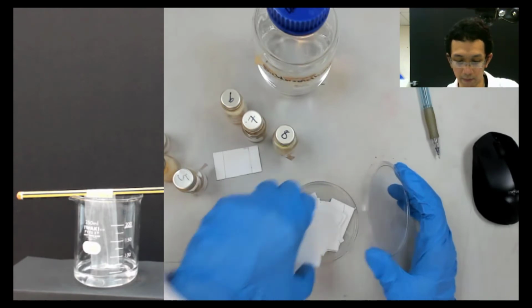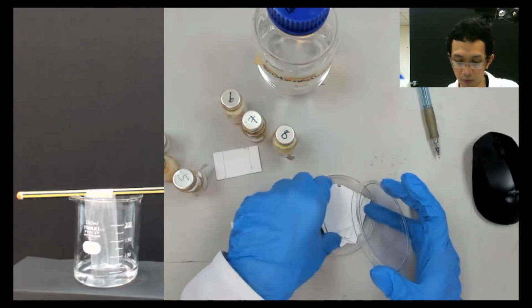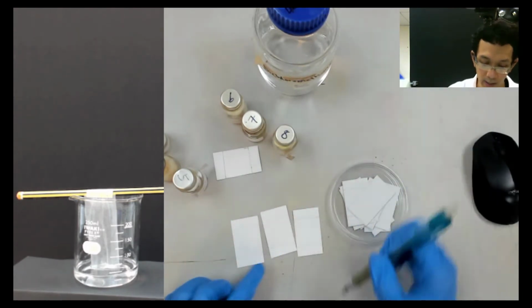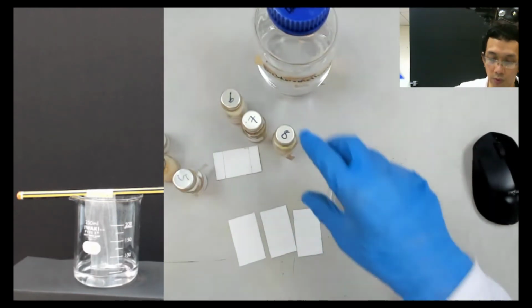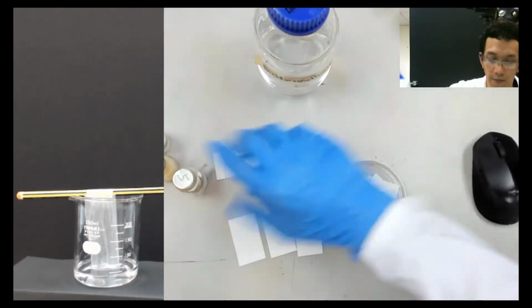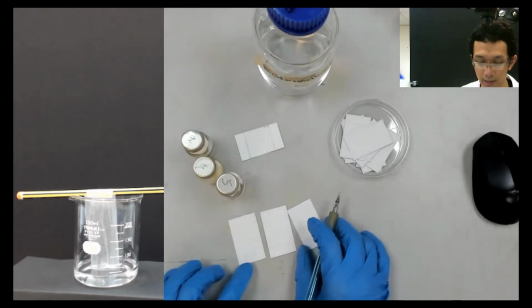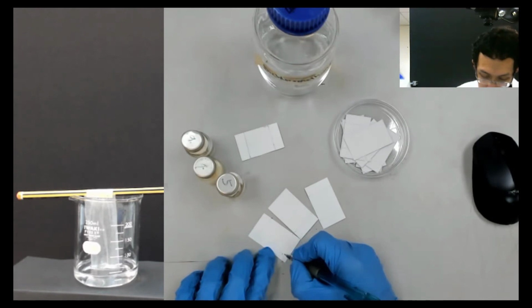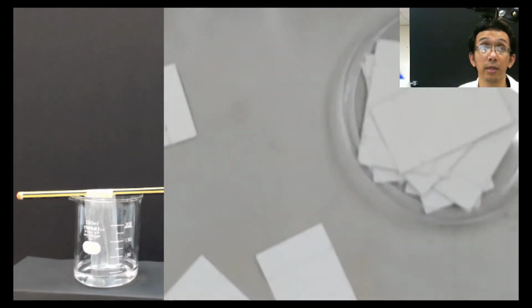So let's say this is for group 2. Okay, this is group 2. We just do 3 plates only. So this, let's say we put X because we know X comes from group 2. So we do it one by one. So 4, 5, 6, 4, 5, 6. So this one, 4, 5, 6 here. So basically, we know that the X comes from this group 2. So we put X here. I will zoom in so that you can see.